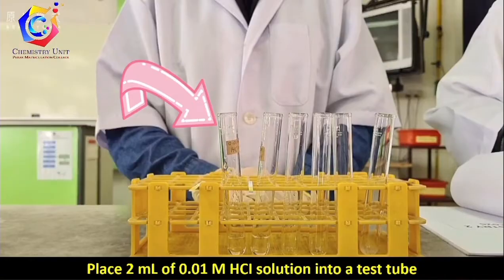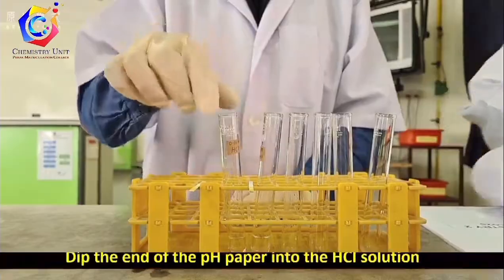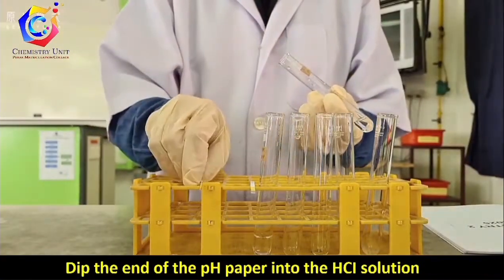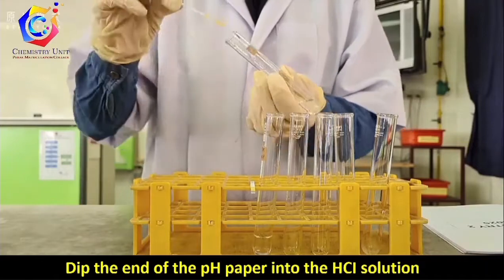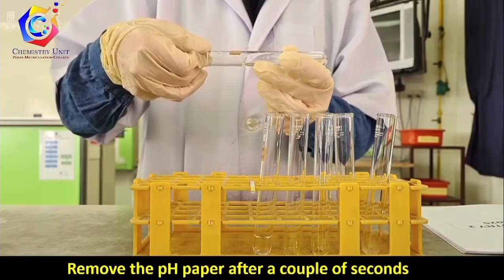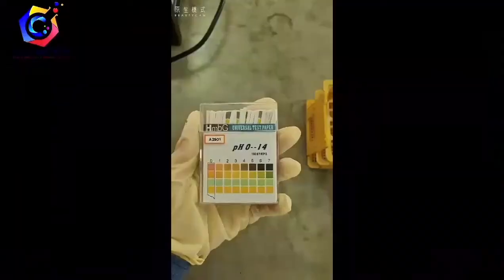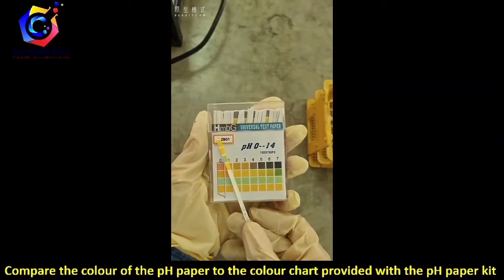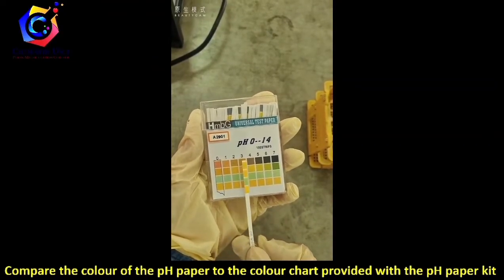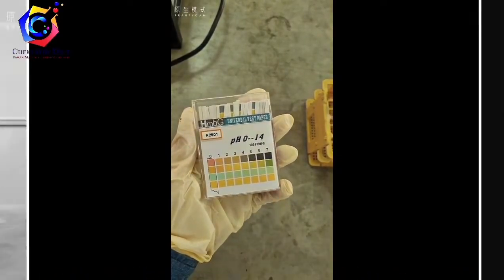Place 2 ml of 0.01 molar HCl solution into a test tube. Dip the end of the pH paper into the HCl solution, then remove the pH paper after a couple of seconds. Compare the color of the pH paper to the color chart provided with the pH paper kit, and record the pH of the solution.